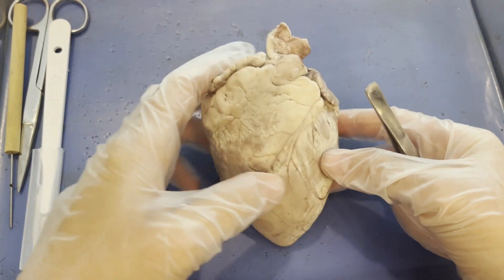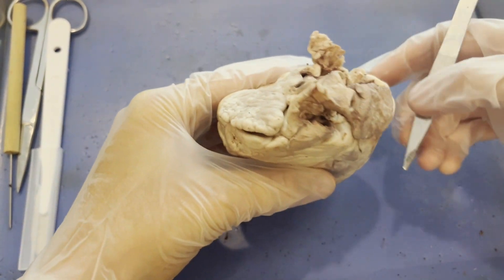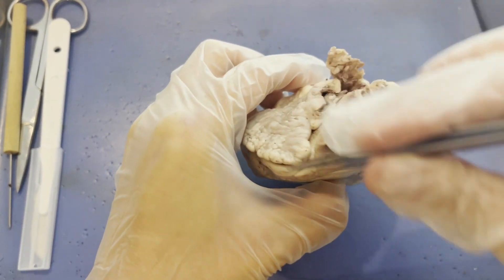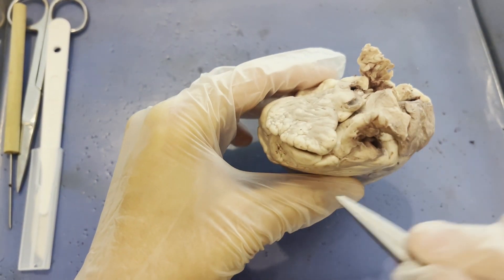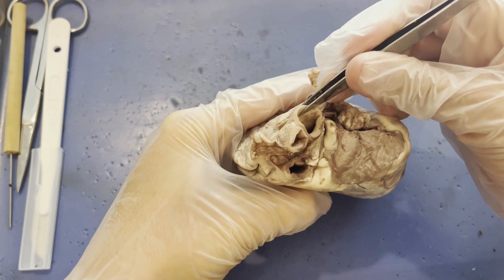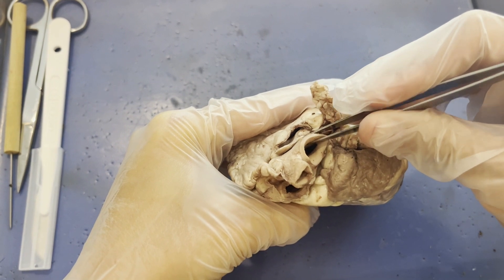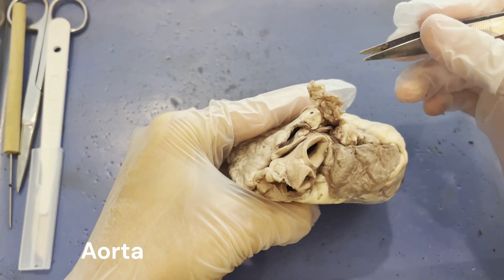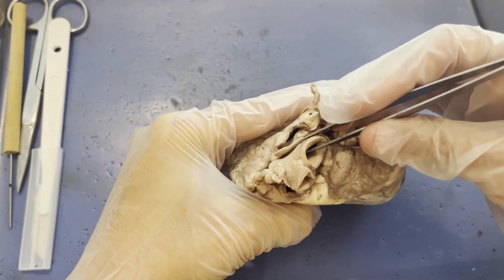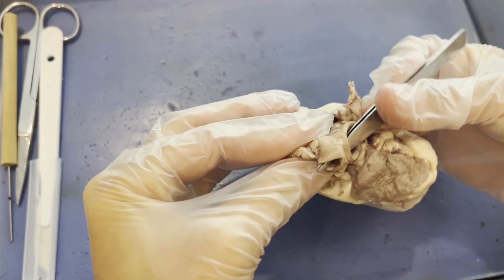For the rest of the external video, we are going to focus on the major blood vessels of the heart. The first and easiest to find is this massive blood vessel at the base of the heart — it's easiest to find because of its size. It has thick walls because this is the aorta, the largest artery in your body. In a human body the aorta is the width of a garden hose. The aorta branches and sends blood out of the heart to all these different places.